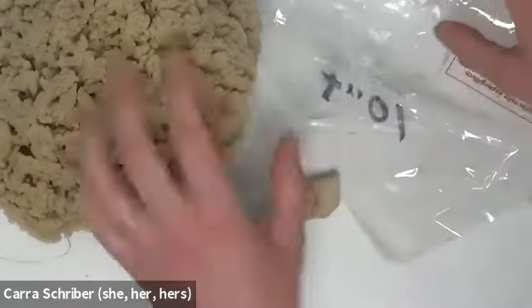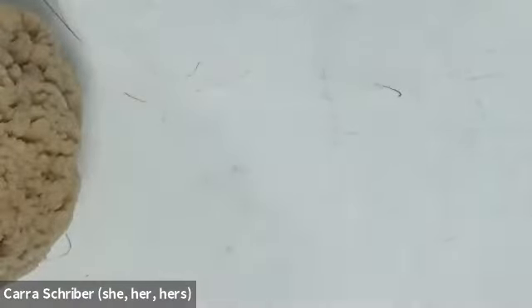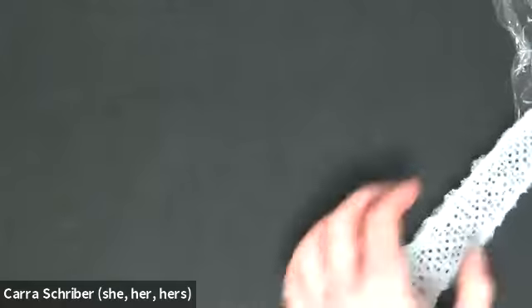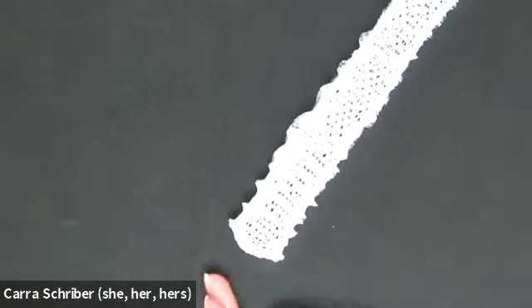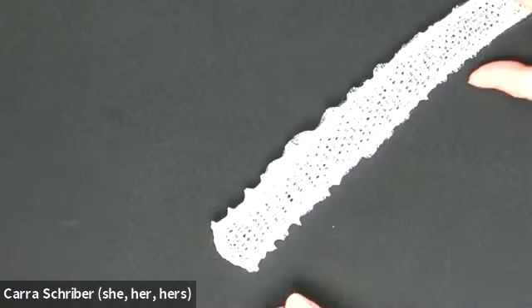And then we also have this third type here. Ooh, the contrast here is horrible. Give me a second. Okay. This sponge is really delicate, so I don't normally take it out of the plastic, but because we're on video and it's really hard for you to see otherwise, I'm going to take it out. This is an example of our glass sponge, okay? So this is that third class, Hexactinellida.